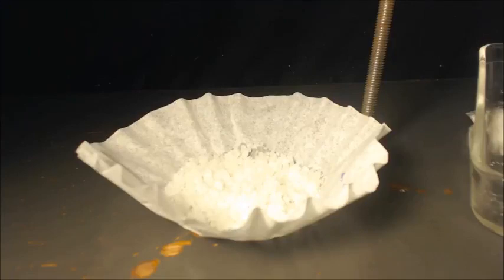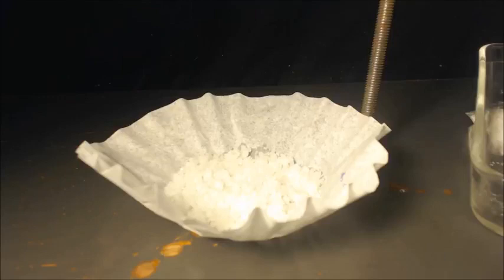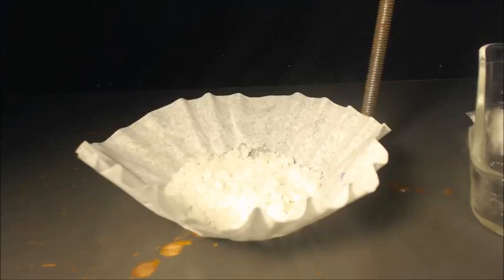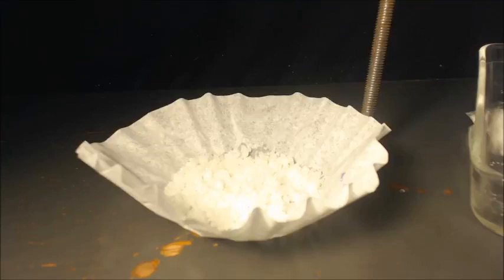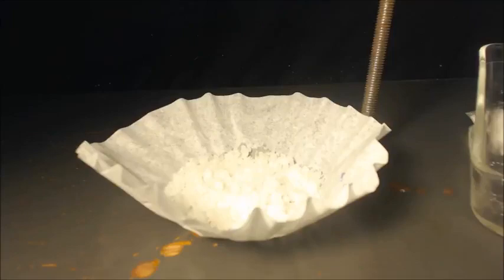The reason I got such a poor yield was because I didn't put an ice bath under the pot when I was adding the ethanol in the very first step, and I didn't have my condenser elongated for the reflux. I should have used a longer condenser. Just because I think this is potassium acetate doesn't mean it is, because it is liquefying right on this thing.